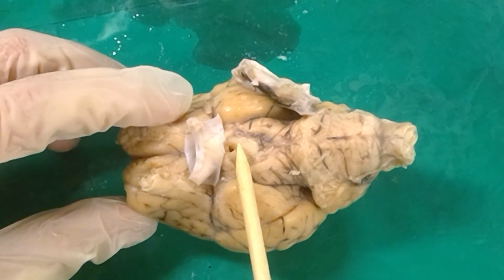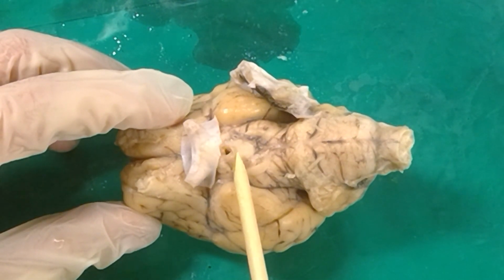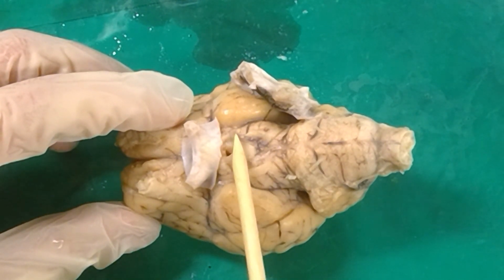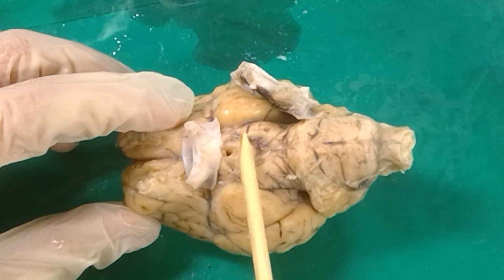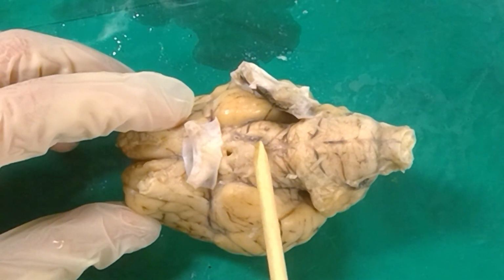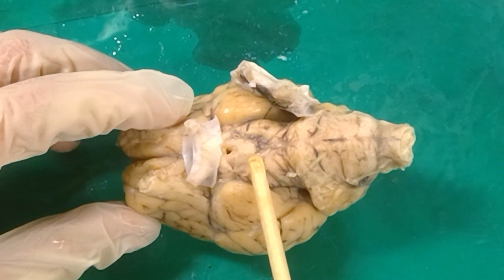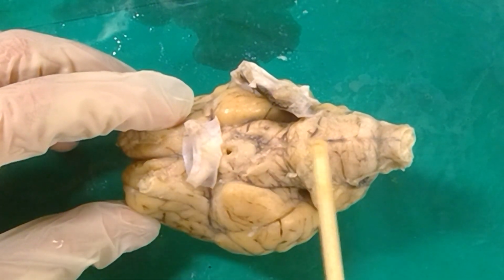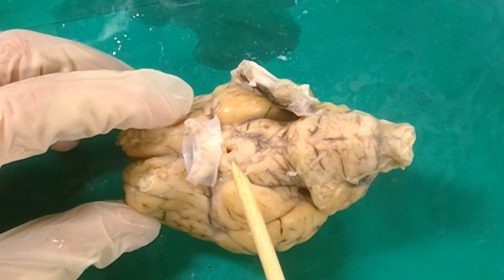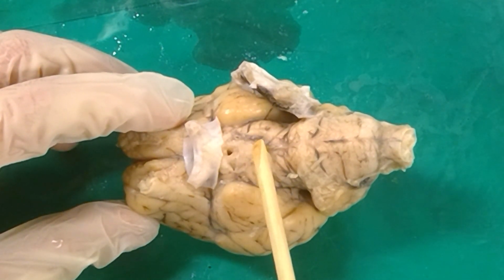Just caudal to the third ventricle hole here that we have, just caudal to the median eminence, we have this sort of triangular shaped bit of tissue. This is known as the mammillary bodies. It's kind of got a white color to it. And it is the only part of the diencephalon that we can see from the outside of the brain. We'll be able to see more structures once we do a sagittal cut along the brain, along the midline here. We'll see more structures of the diencephalon, but from the outside of the brain, really all we can see is the mammillary bodies right here.